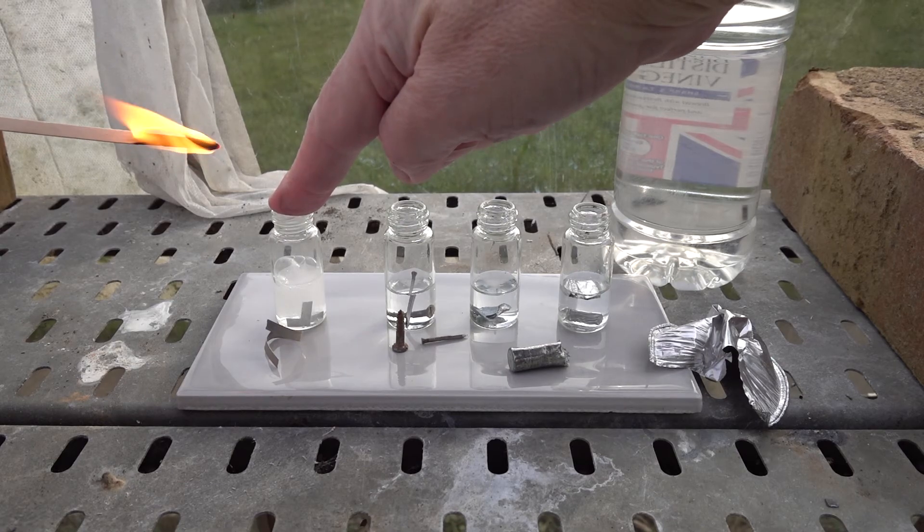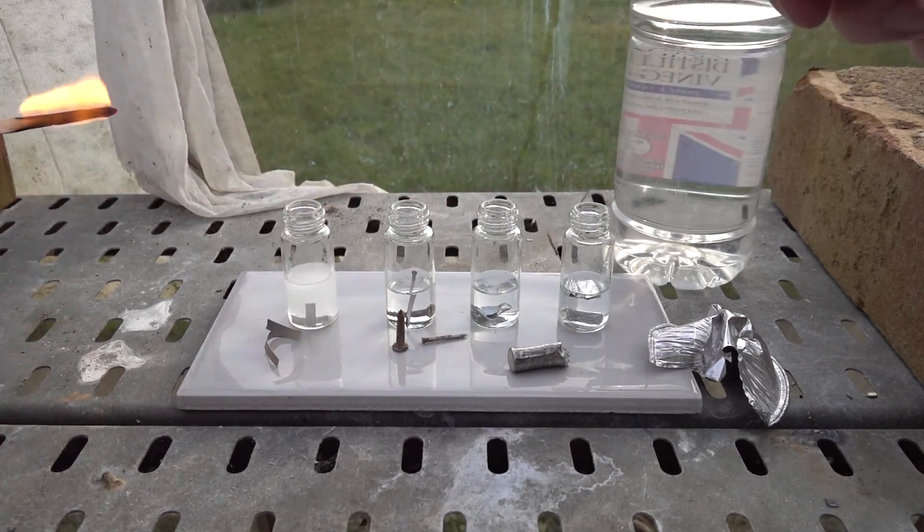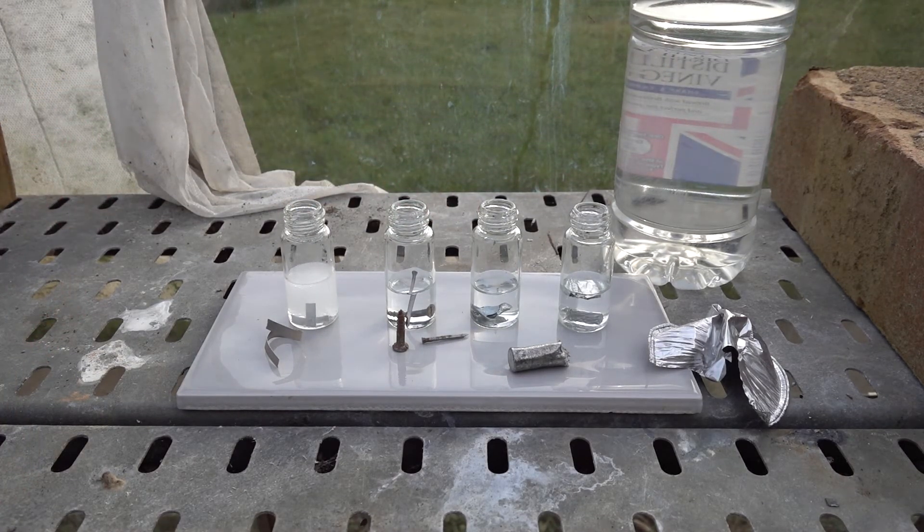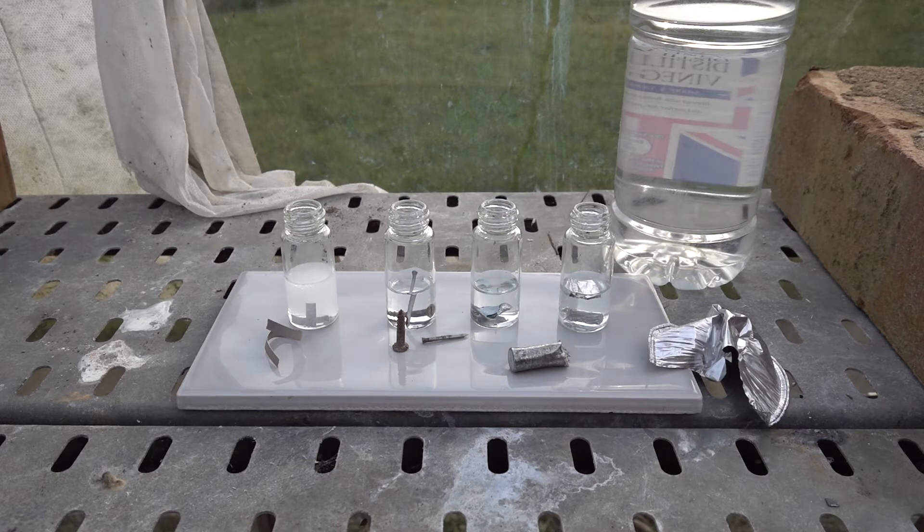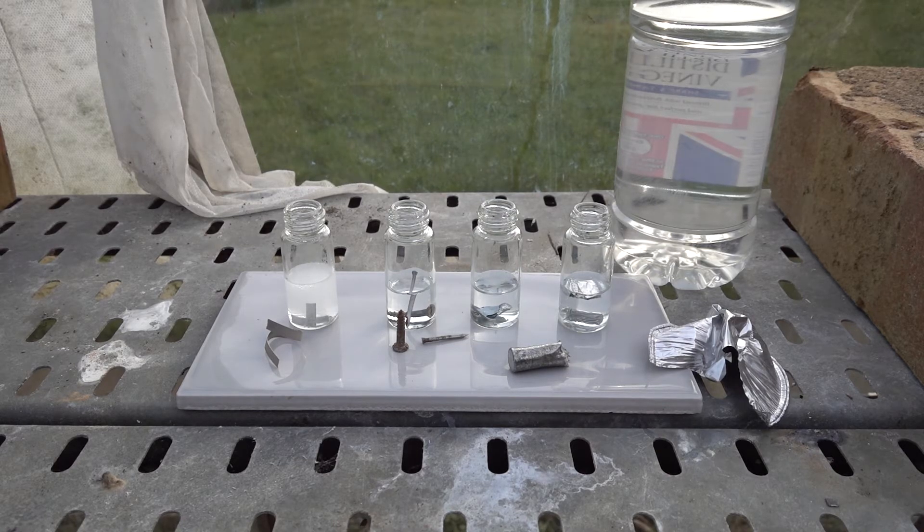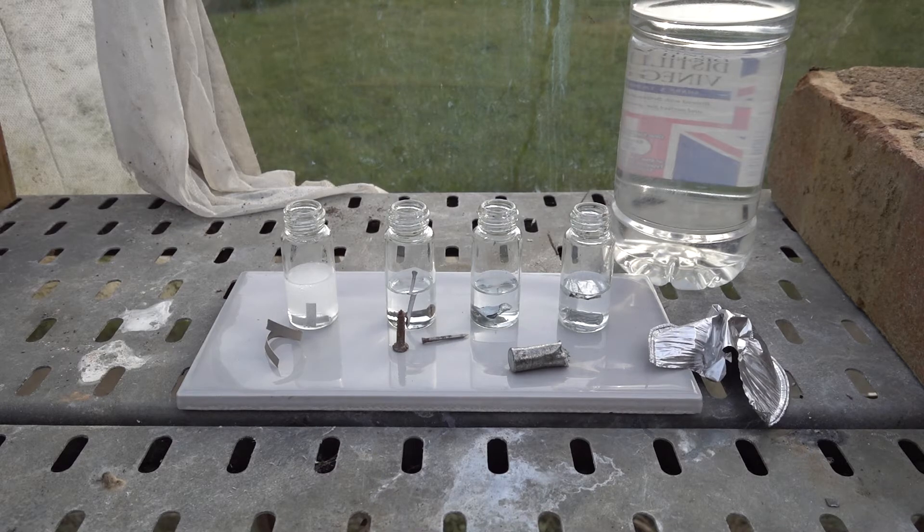So here's a splint and a positive little test there. Confirming hydrogen is produced when magnesium reacts with vinegar.